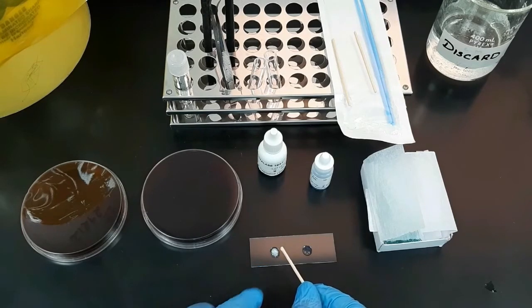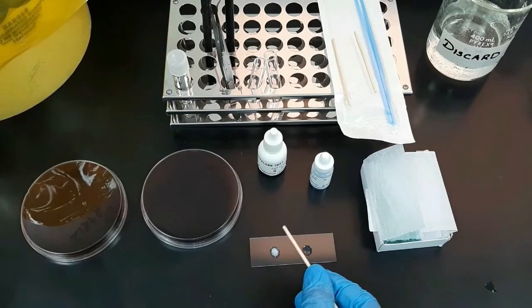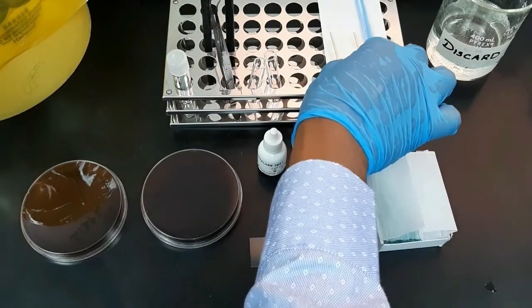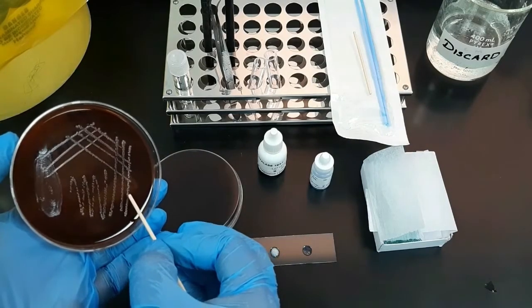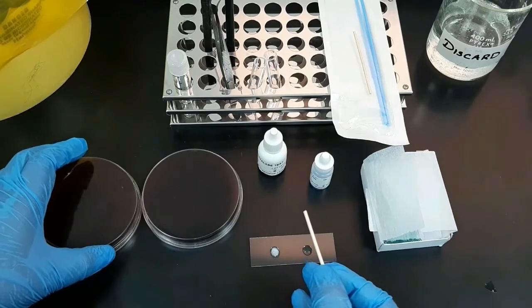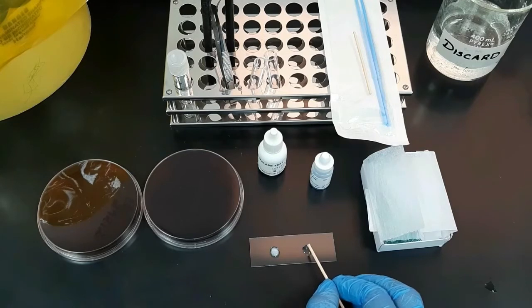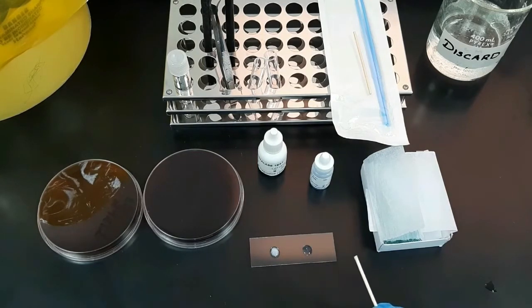The immediate appearance of bubbles shows a positive result. Discard the stick immediately into the discarding bag. Next, repeat the same procedure with the negative control bacteria. This time no bubbles should form, which is considered catalase negative.